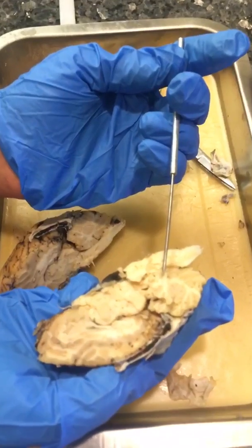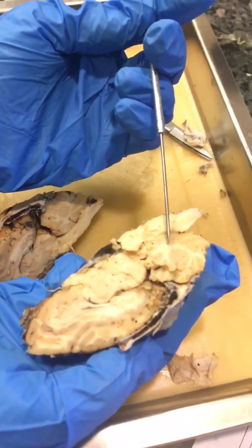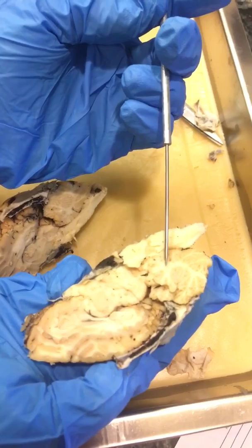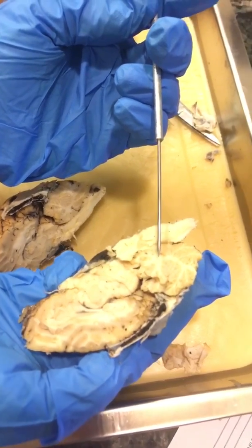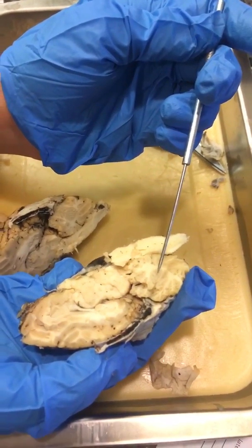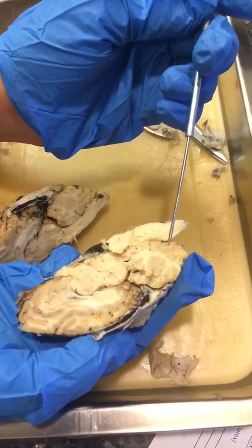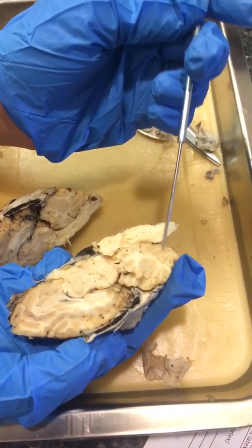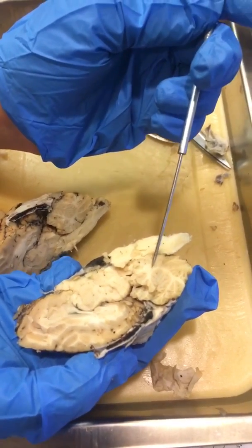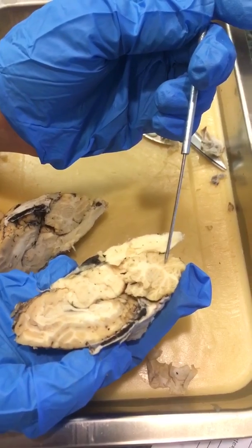Here you can see quite obviously that this is the white matter — the lighter area. The darker matter is known as the gray matter. Again, this is the white matter, this is the gray matter.